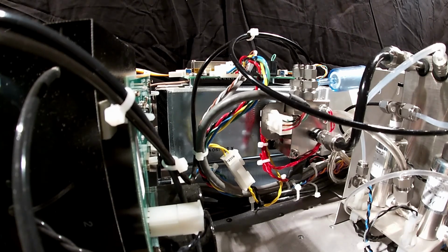That's our reaction chamber cleaning for a T200 chemiluminescence analyzer of any version. Again, you may or may not see the gold nozzle director in there. That's a feature we put on all of them now, so if you've got an older analyzer, get in touch with us. I'll put that part number in the video so that you've got that. That's it.